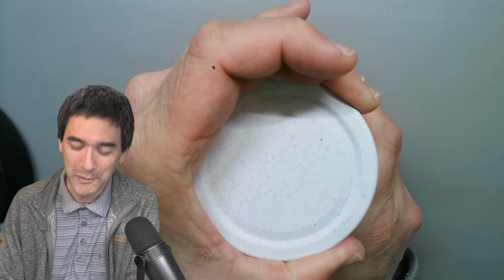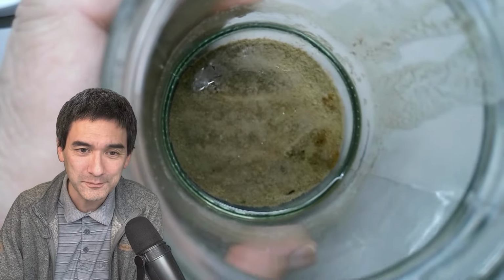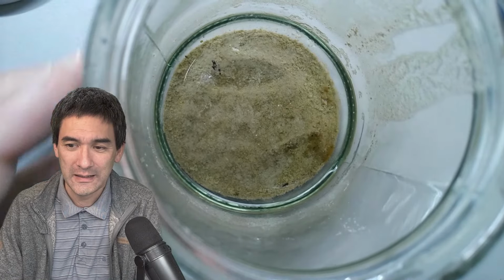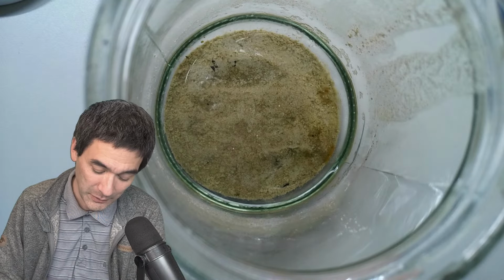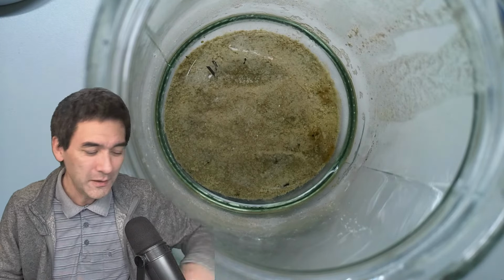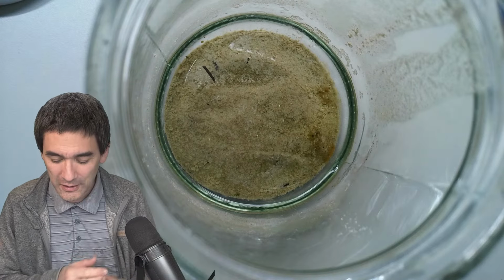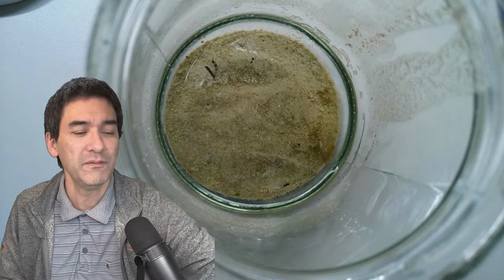Also something that I have not been looking at for a few months now, or almost a year now, and let's see how well this actually works. Be very careful. No, it's not chess this time. Normally, sometimes on Saturday I have to go with my son to a chess competition. Look how dusty it is, but this time it's not. This time it's for private reasons. This here is marine water from northern Germany. I made holidays there. I just collected some sand there, and I would like to see if something is still alive. About 3 years ago I visited northern Germany, and there were lots of diatoms in there, and of course they cannot survive 3 years. But I would like to know if by any chance there is still something visible in there.